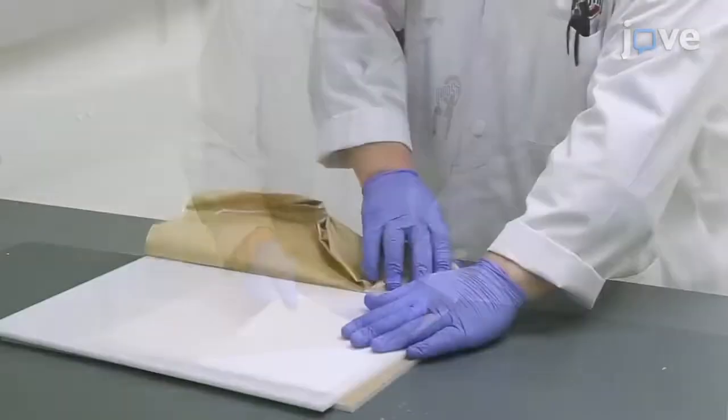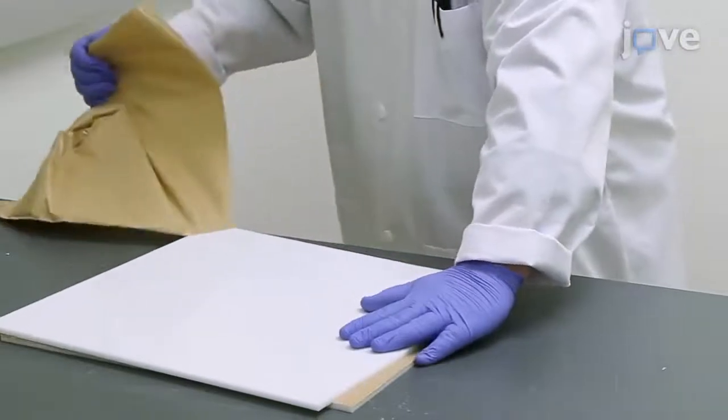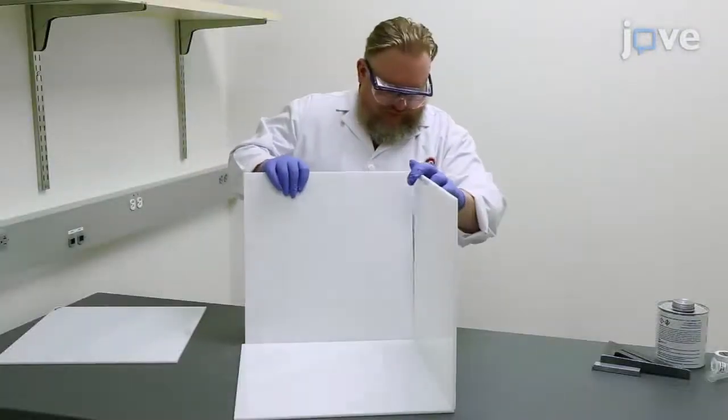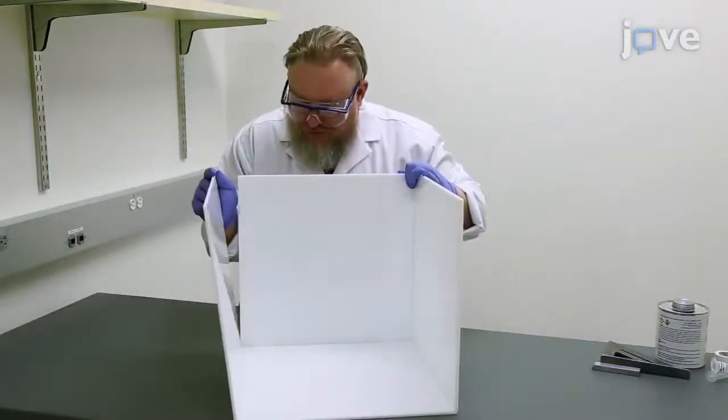Remove the protective paper coating from the acrylic sheets. Then, dry-fit all the materials to confirm that sizes are correct.